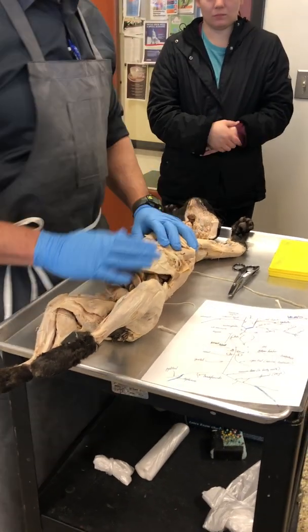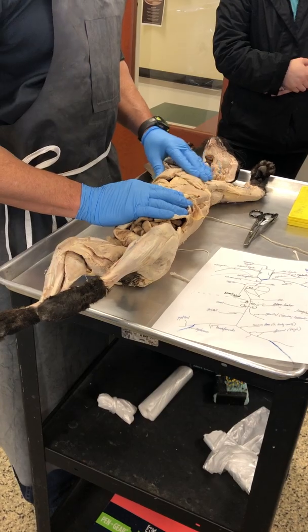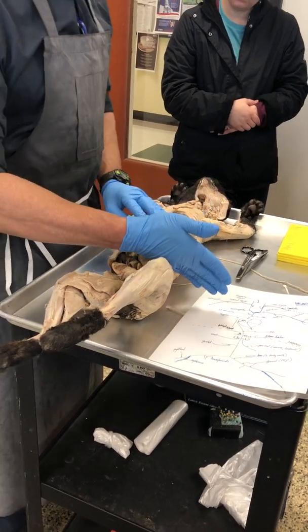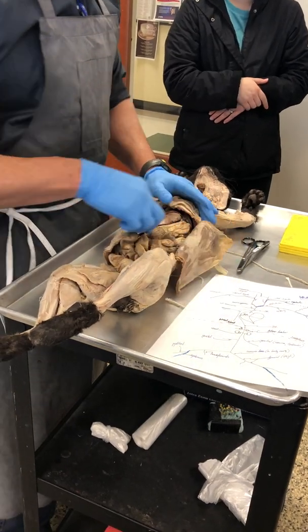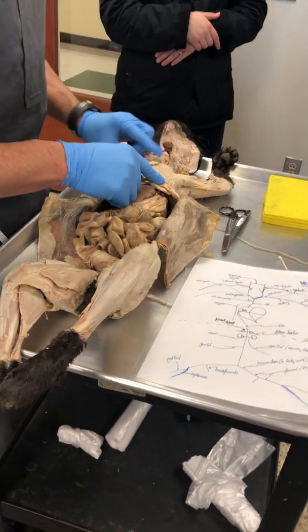And I will open up and dissect the cat for you to see how we get to that. And you can see here the ways that we cut it, right? Mid-sagittal plane, all the way up. And then across right here, there's the abdominopelvic cavity. You'll feel the ribs there. You peel that back there. You peel it back there. Right? So there's the rib cage right there, folks.